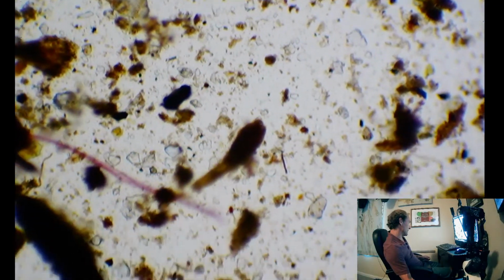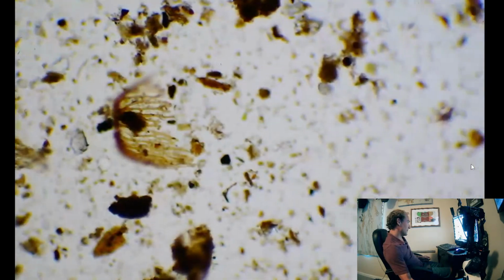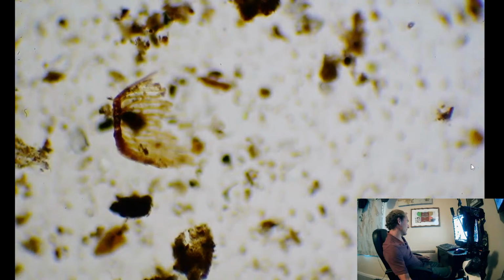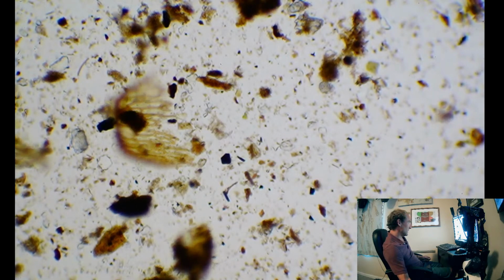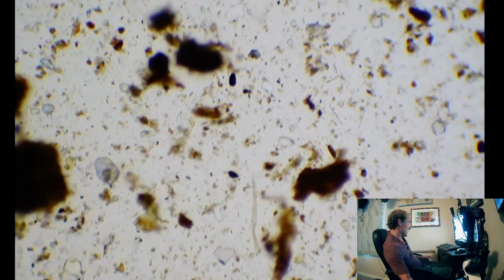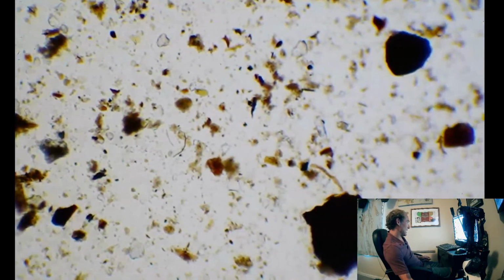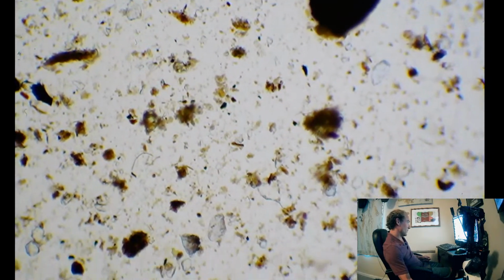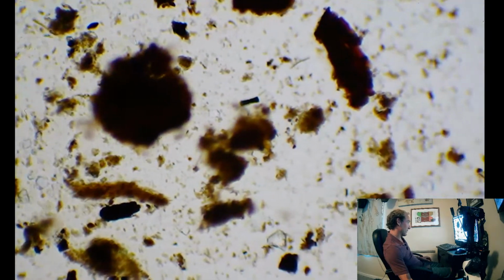But there's one little piece here, but very little fungi. Yep, some more organic matter here. But if we want to prevent things like powdery mildew and other fungal pathogens, like that I have here on my sorghum, we need closer to a 1-to-1 fungal to bacterial ratio.